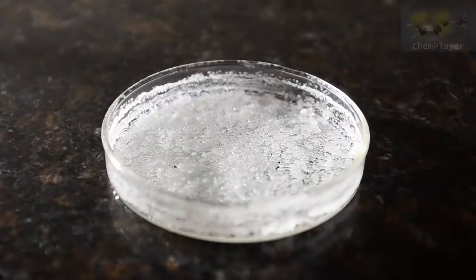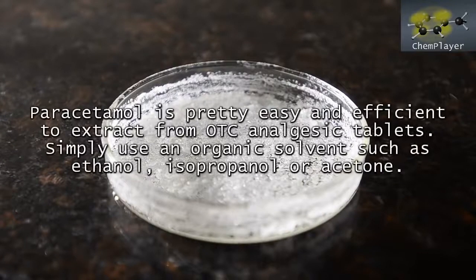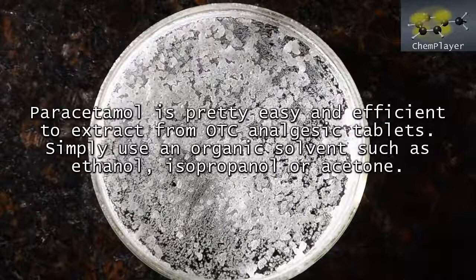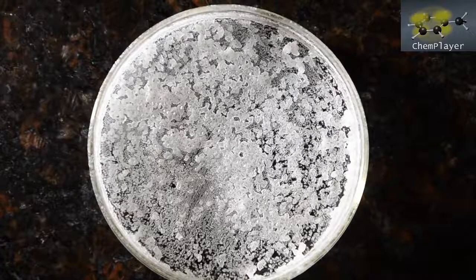We've shown you in the previous video how it's quite easy to extract pure paracetamol from tablets using an organic solvent such as acetone, ethanol or isopropanol. Acetone is our favorite as it's efficient and easy, and evaporates quickly leaving crystals like this.